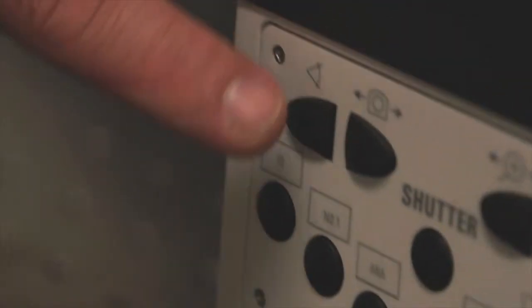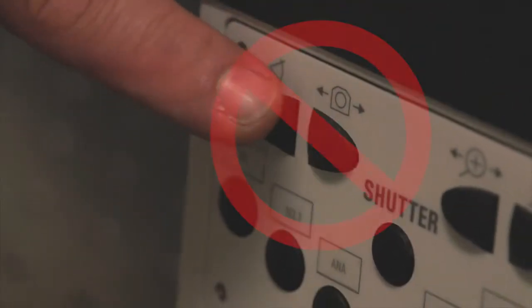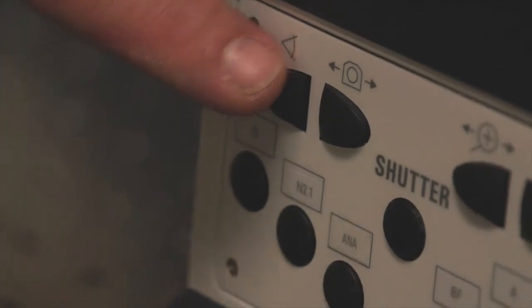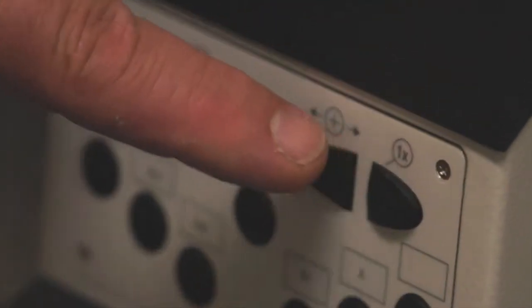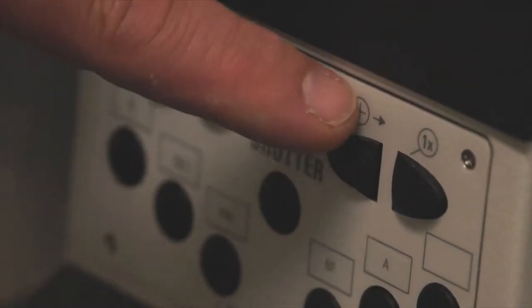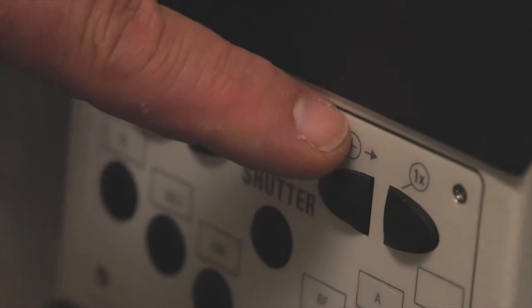Do not touch these two buttons on the front of the microscope, and only rarely will you actuate one of these buttons, which we will discuss at a later date.